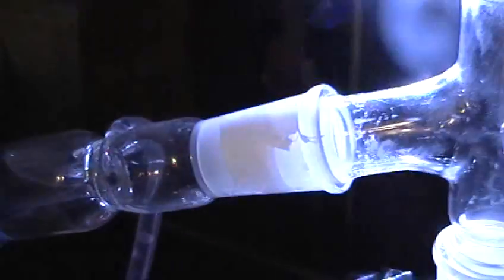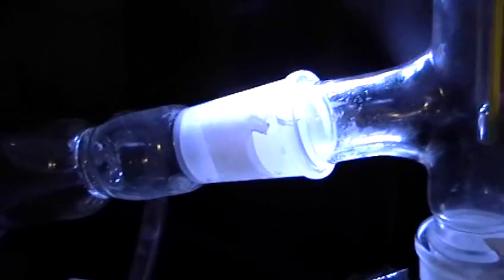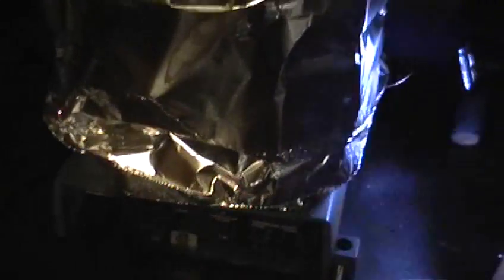You can see the motion of the bubbling. It's real dirty — it's full of something that we think is lead. But all of the ground glass joints have been wrapped in Teflon tape, because I was going to use Vaseline at first, but the Teflon is more heat resistant. Underneath the interface between the hot plate and the boiling flask, it's wrapped up in foil — it's kind of an improvised sand bath to transfer more heat into the mercury.